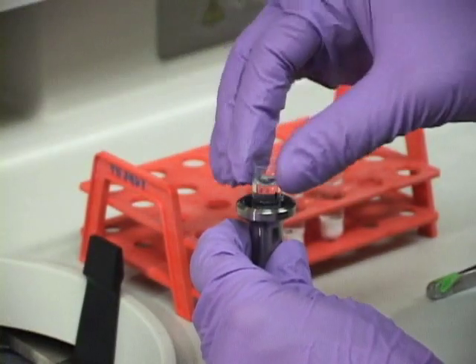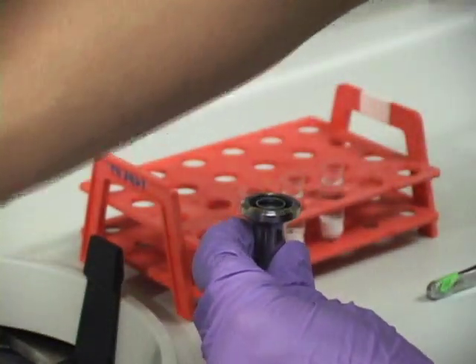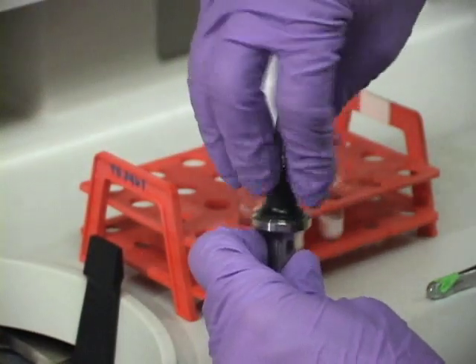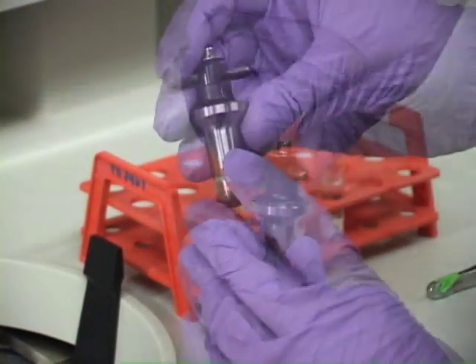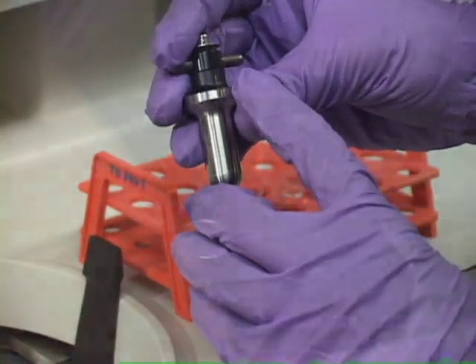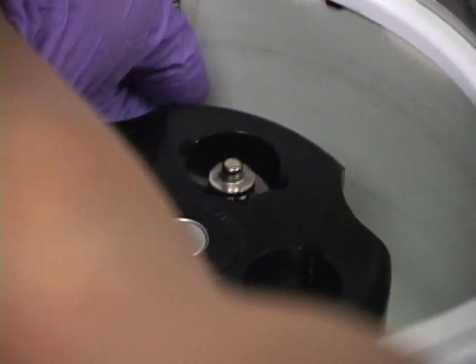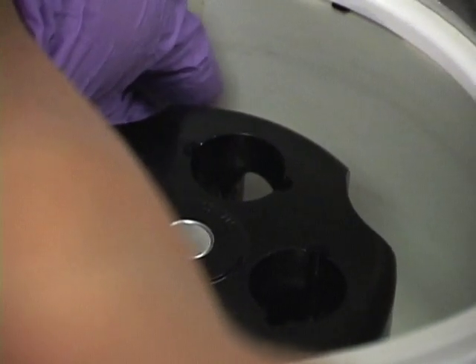Carefully load your samples into the holders and tighten so that the number on the lid and the holder align. Place into the rotor gently. Our samples are balanced by volume.